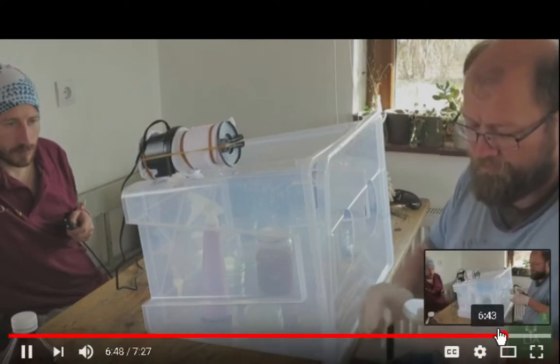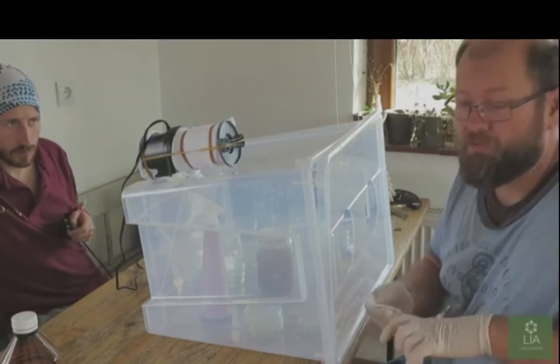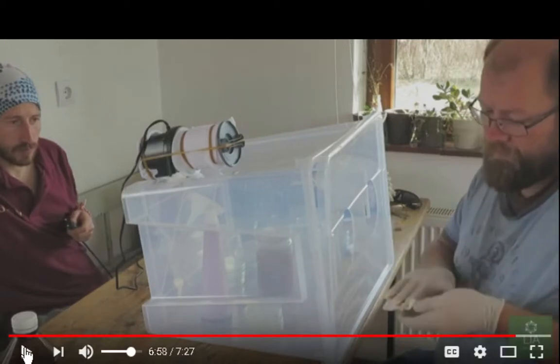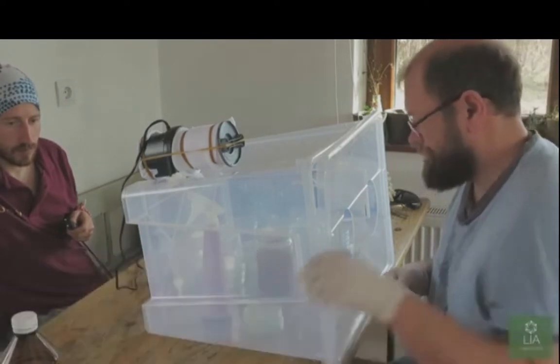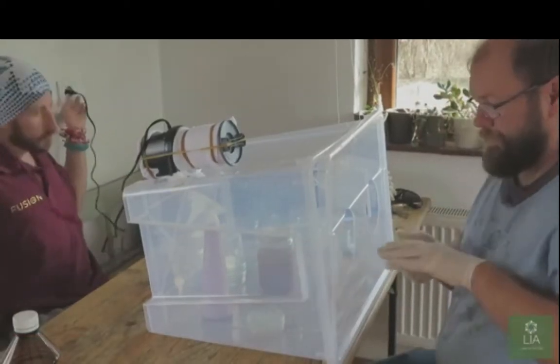And there's something else. You want basically around about a millimetre of agar on the bottom of the Petri dish. I was told to have enough fluid so that the fluid level comes up to the level of the top of the edge of the cover, because that's all you need for the mycelium to colonize. Wait till you see what solution I've conjured up.